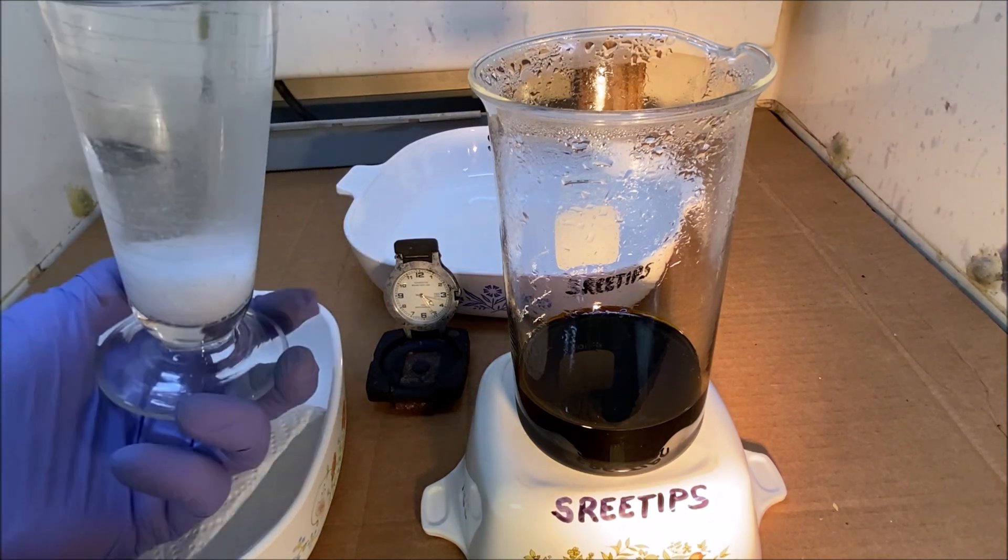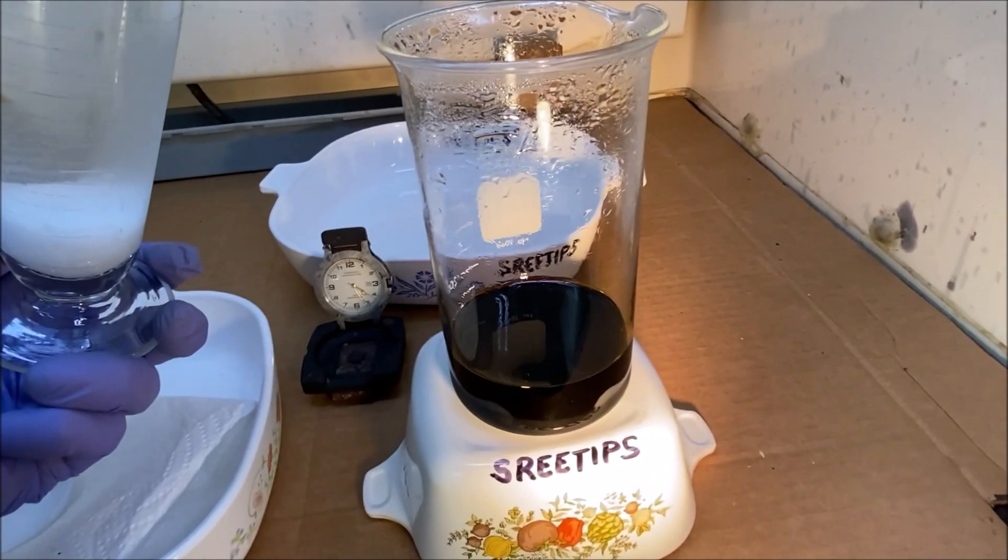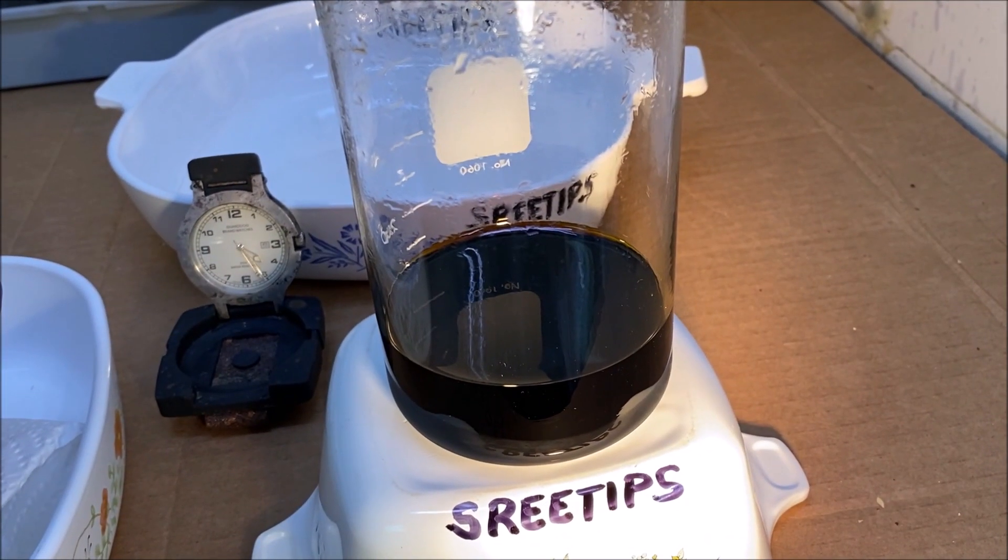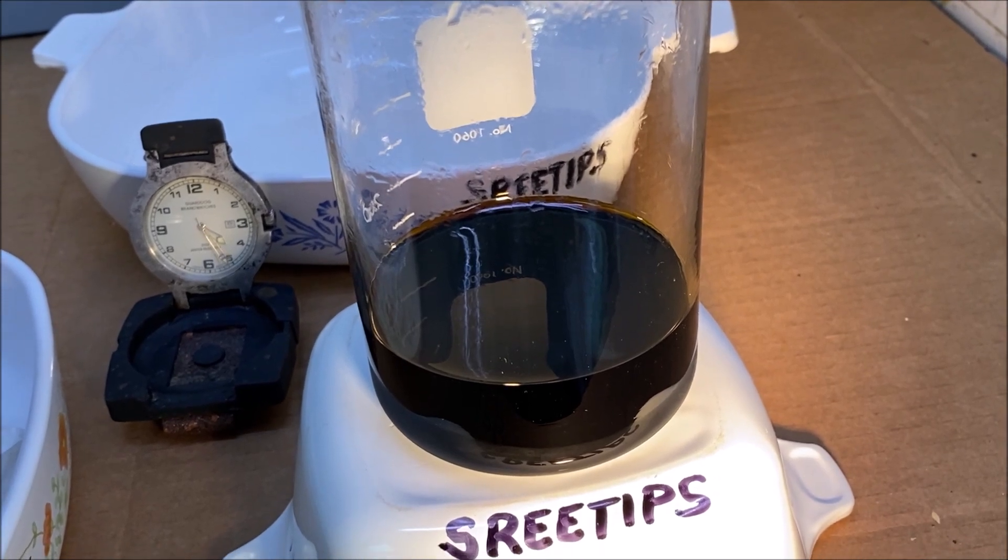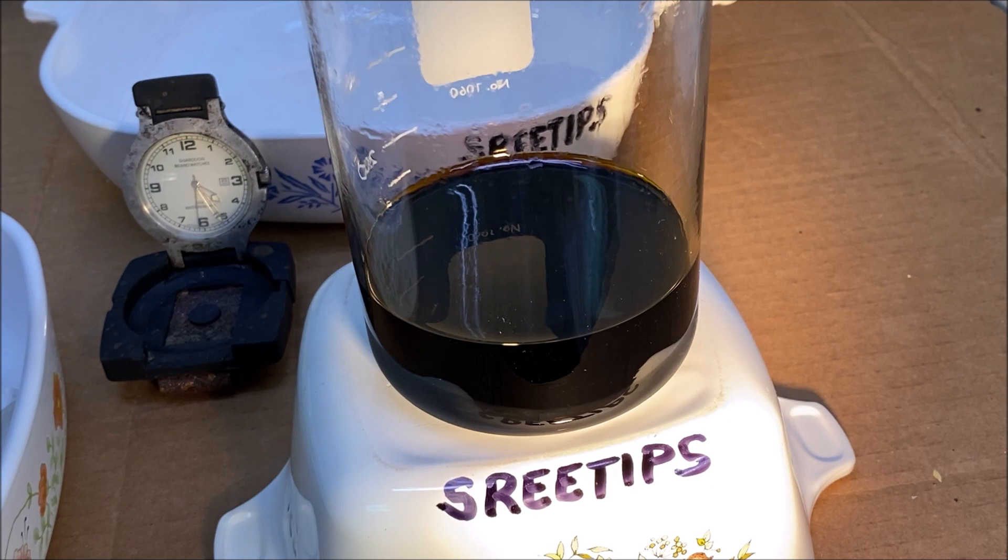We're going to add the ammonium chloride to the solution, and we should see a precipitation of some platinum here. And I need to add an excess of ammonium chloride because that will be required for the next step in the process when we go after the palladium. Here we go, here goes the ammonium chloride.